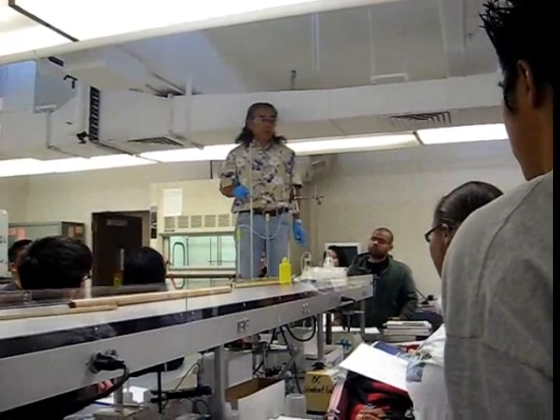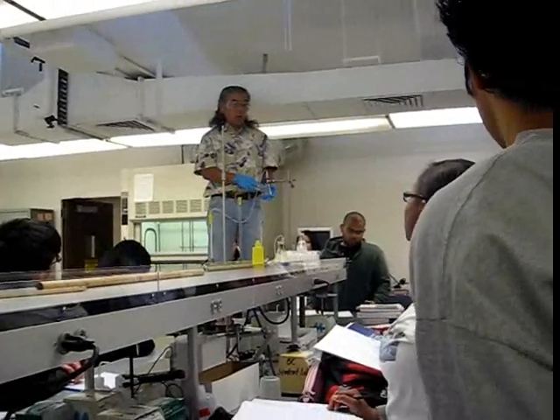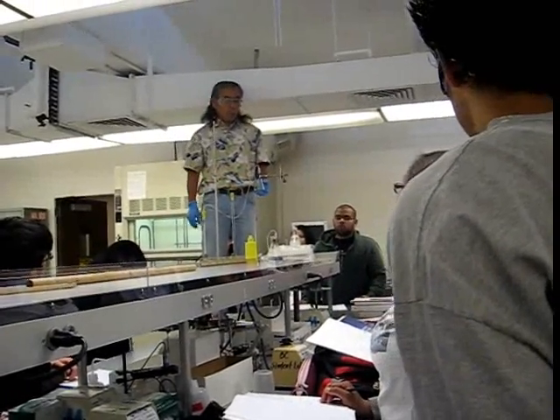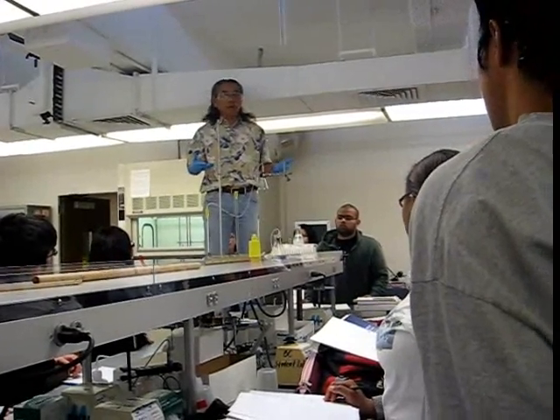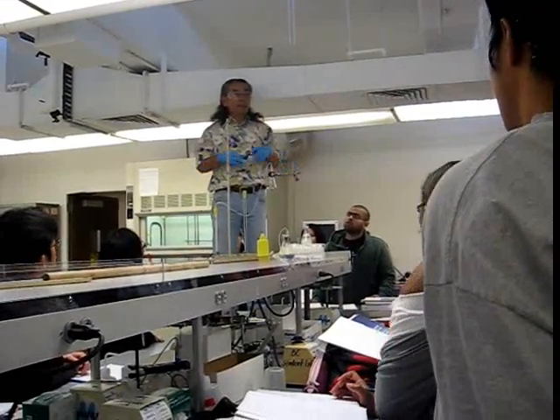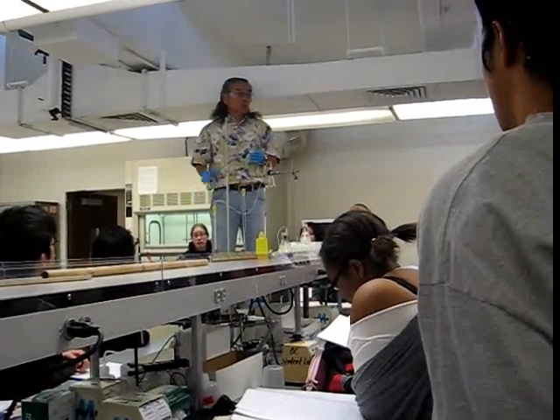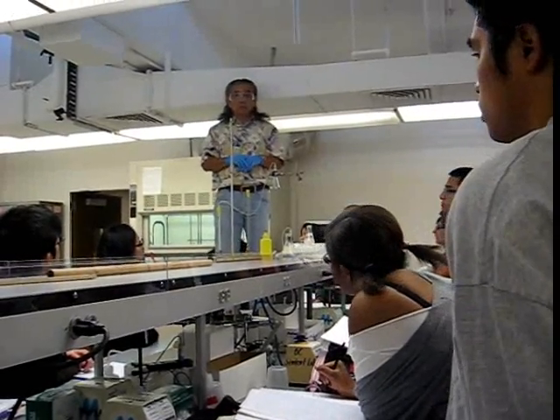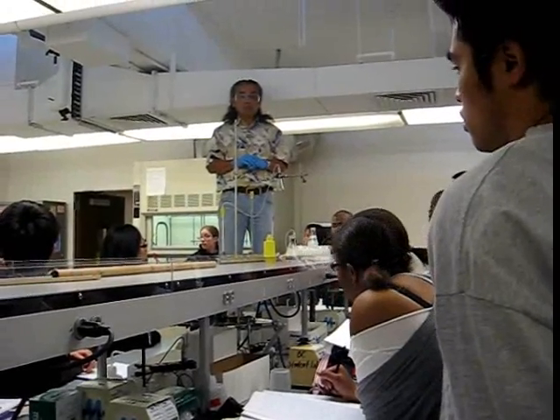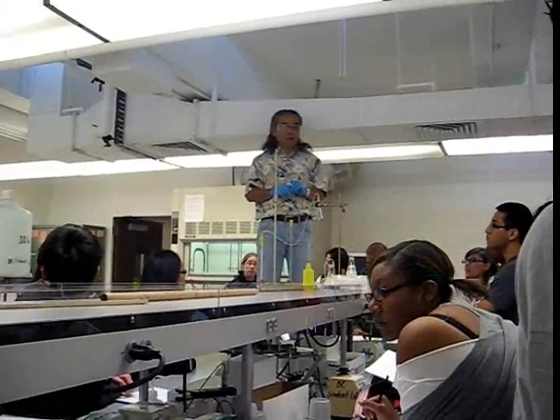Columns take a long time. You have to be very efficient, so you do the work as a team. Once you start on the column, you need to work efficiently. When you come to the lab, ten minutes after, barring any type of announcements, you should be good to go. You can see the set-up time — Rob's done it lots of times. For you guys, set-up time could be like 20 to 30 minutes, or maybe more.